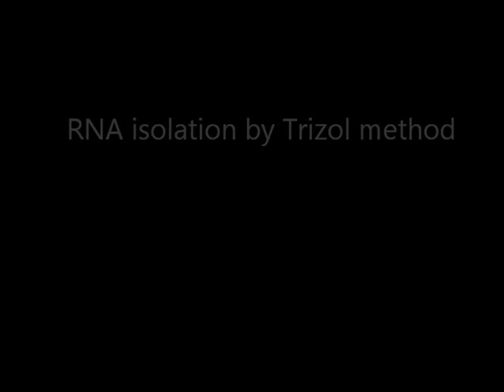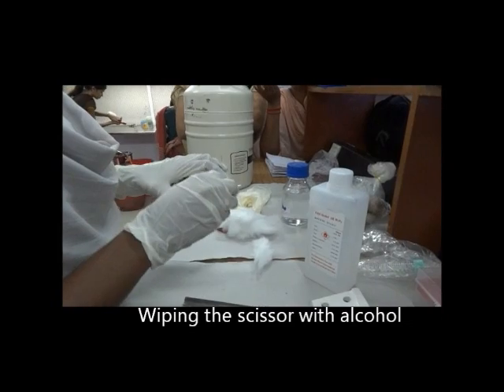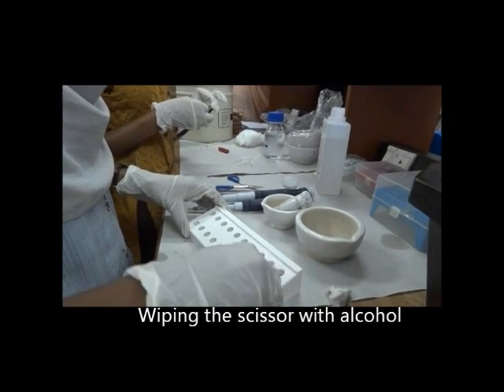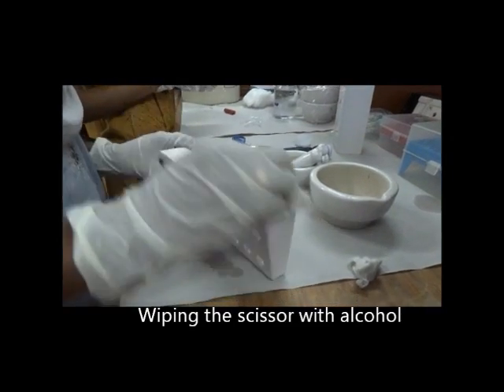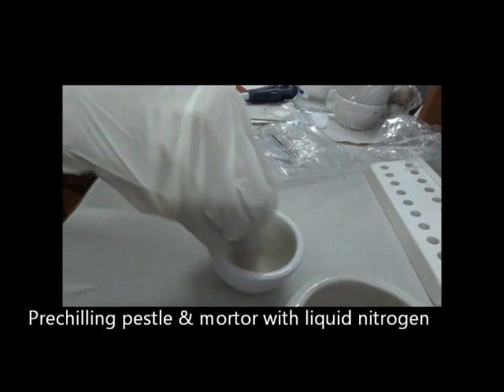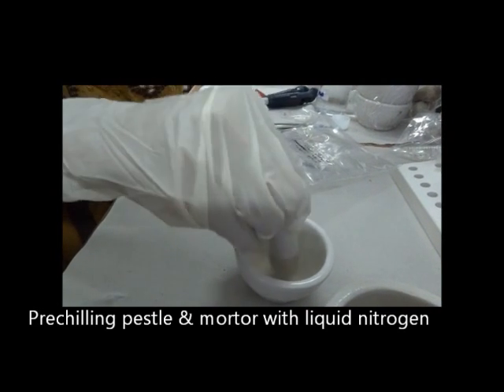RNA isolation by the Trizol method. First of all, the scissors and pipettes used for RNA isolation are wiped with 70% ethanol to prevent RNA degradation by RNAases. Also, pre-chill the pestle and mortar with liquid nitrogen to prevent RNA degradation.